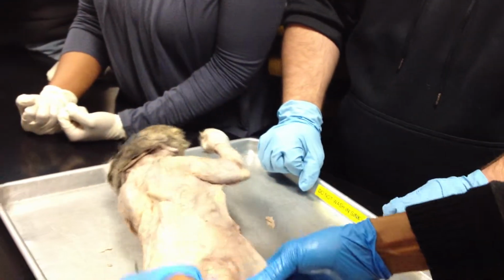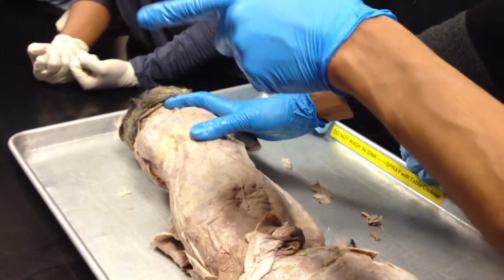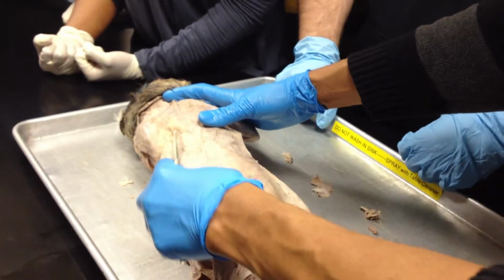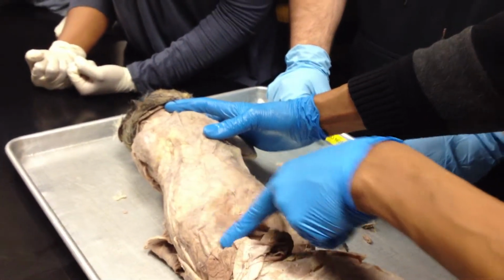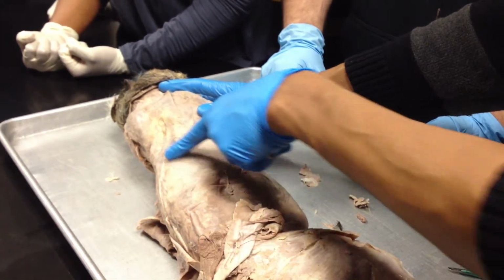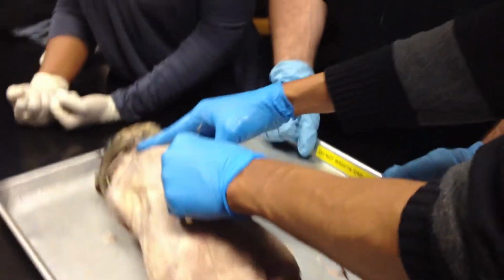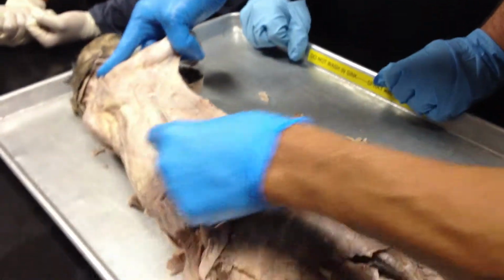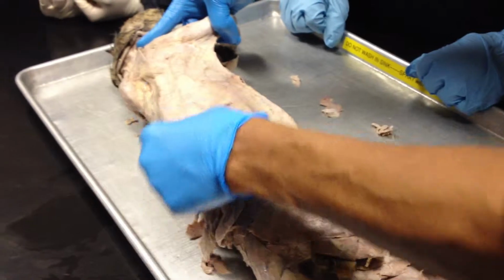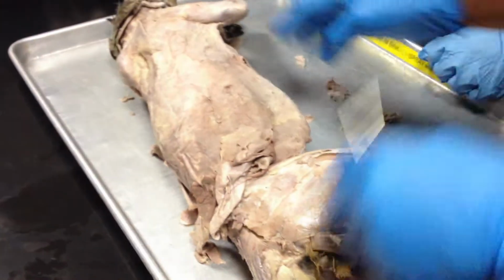And then on the back of the cat, we had the latissimus. Okay, so that's a muscle that I have forgot about completely. But everybody seen the Latissimus Dorsi? Yes. So a muscle originates from the back here, what we call the lumbar fascia, this back white portion here. Originate from the vertebrae here and some of the ribs, and then it travels all the way across here and attaches to the humerus. So you're able to see on some of your dissection this Latissimus Dorsi here. So the only muscle of the back that we were to identify.